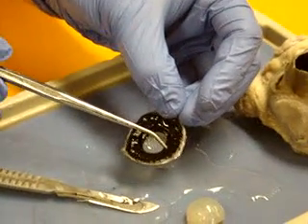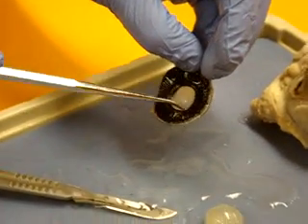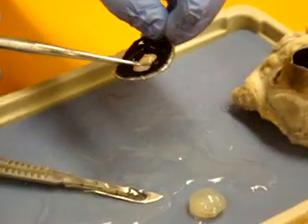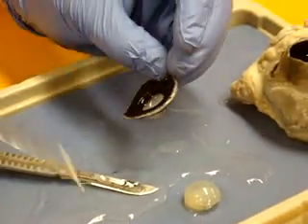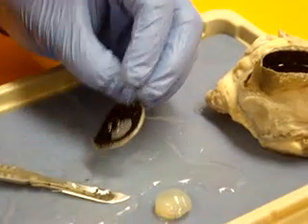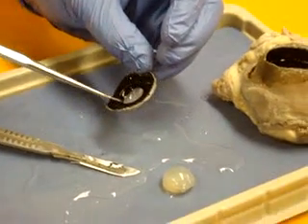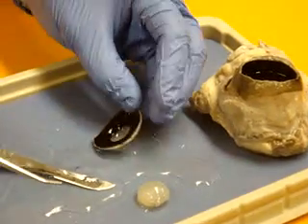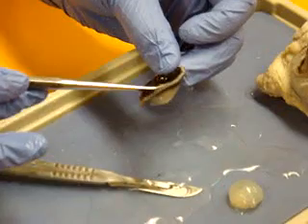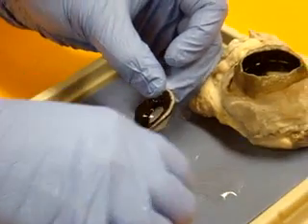The ciliary body in front of the lens projects out this little flap — that's the iris. The opening between the irises in the center is the pupil, so the pupil is an opening. The ciliary body and the iris are still part of the vascular tunic. So the vascular tunic is the choroid in the posterior cavity, and then the ciliary body and iris in the anterior cavity. The anterior chamber of the anterior cavity is between the cornea and the iris, and then the posterior chamber of the anterior cavity is between the iris and the lens.